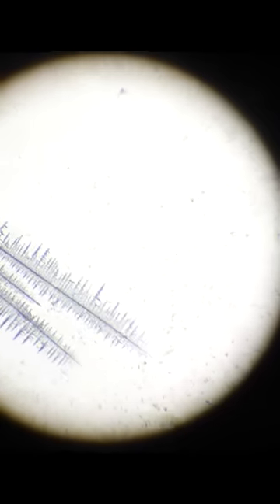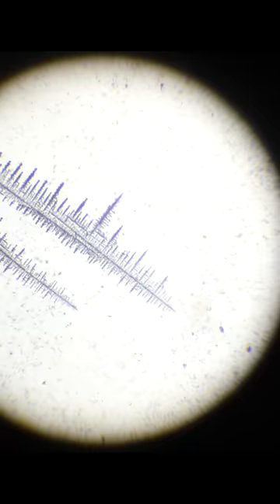This video is in real time, it's not sped up at all. You can see that the crystals start from a nucleation site and then grow until they hit some defect.